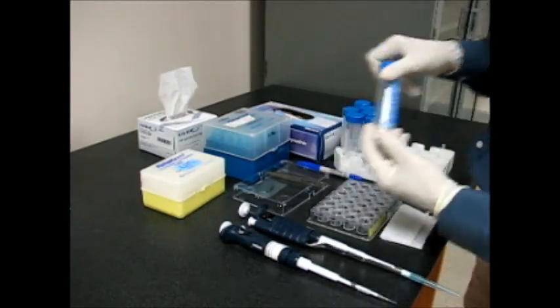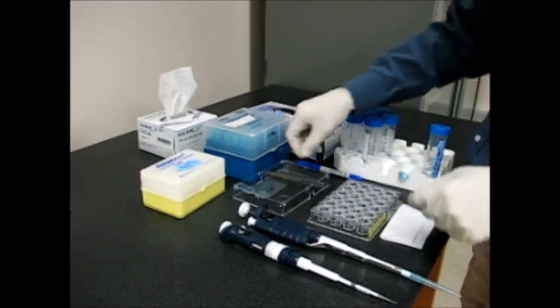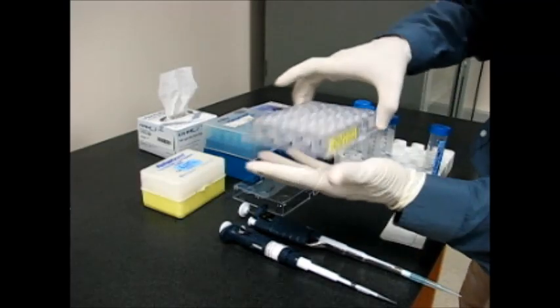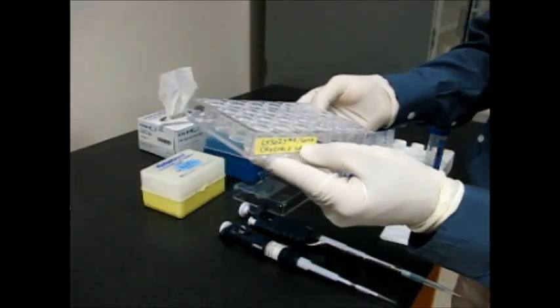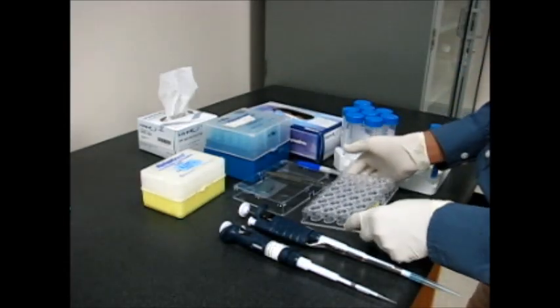We also need a VDX plate with pre-greased wells with the name of the protein written at the bottom tray so that it won't be mixed up, and the lid.